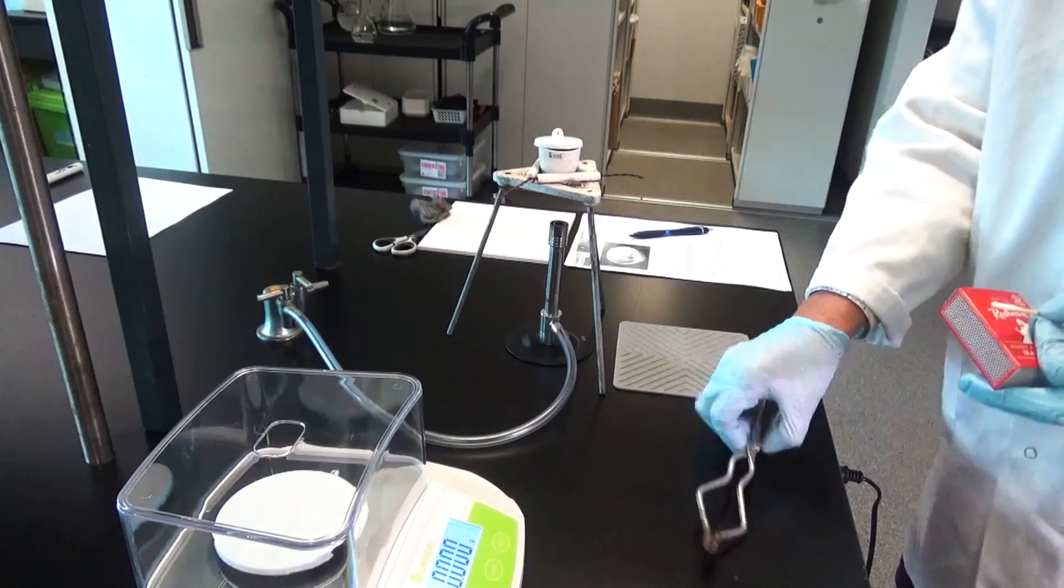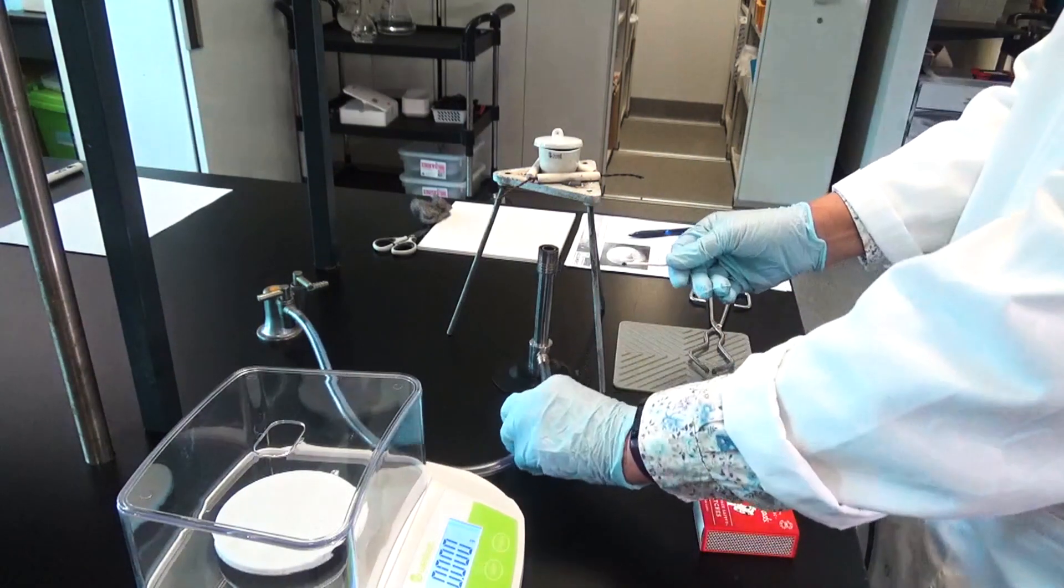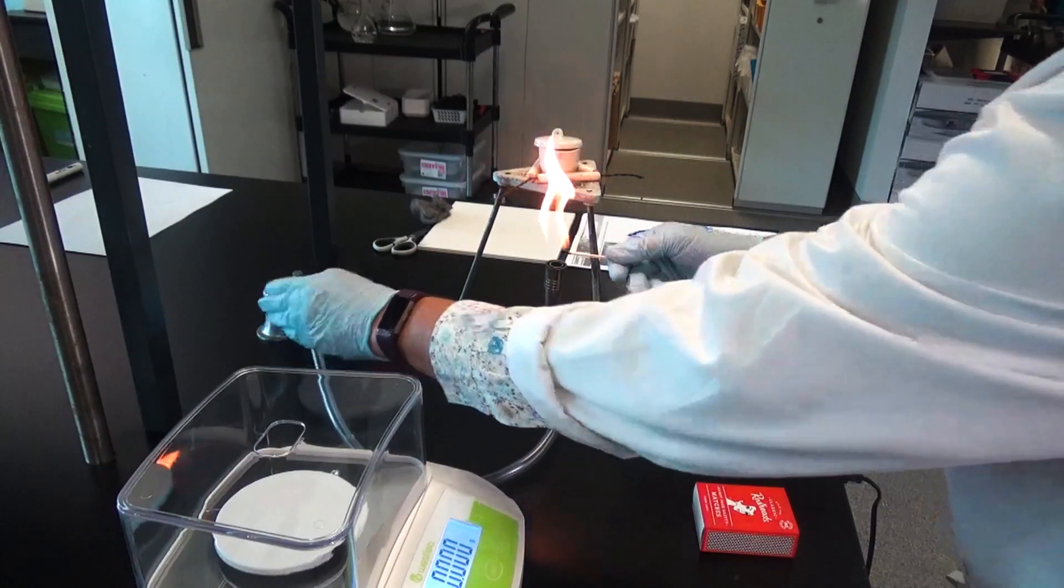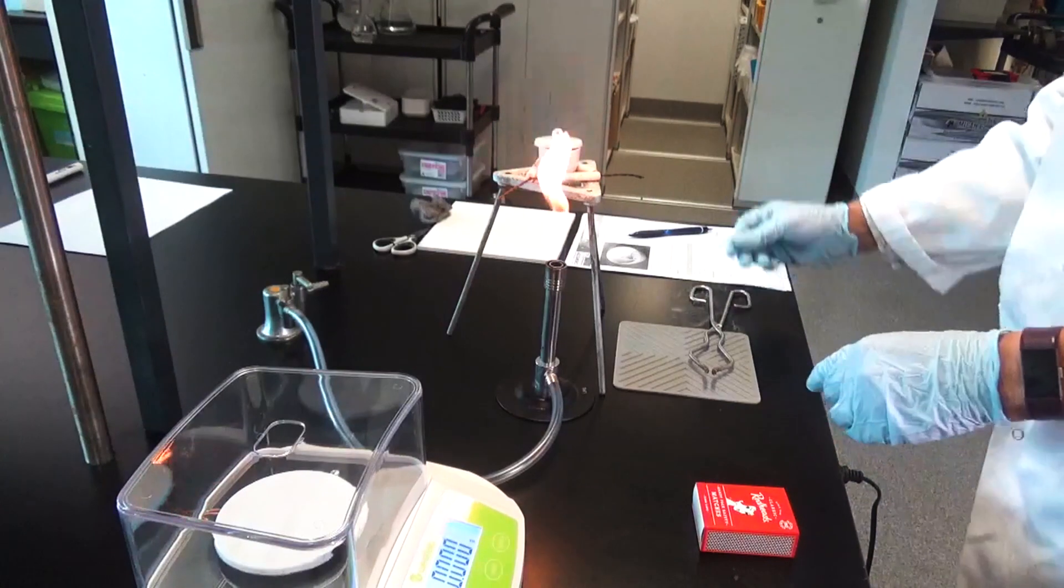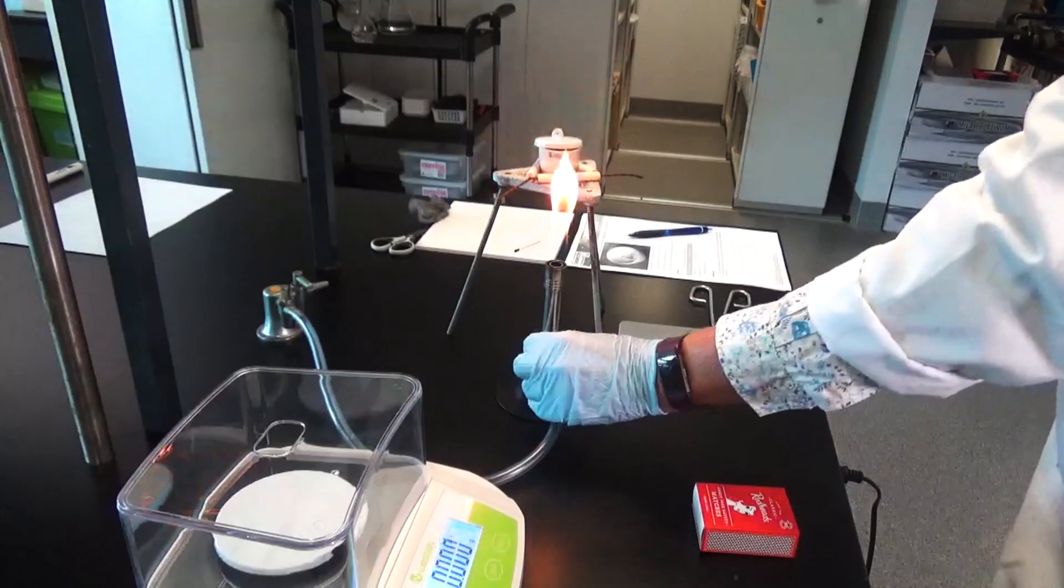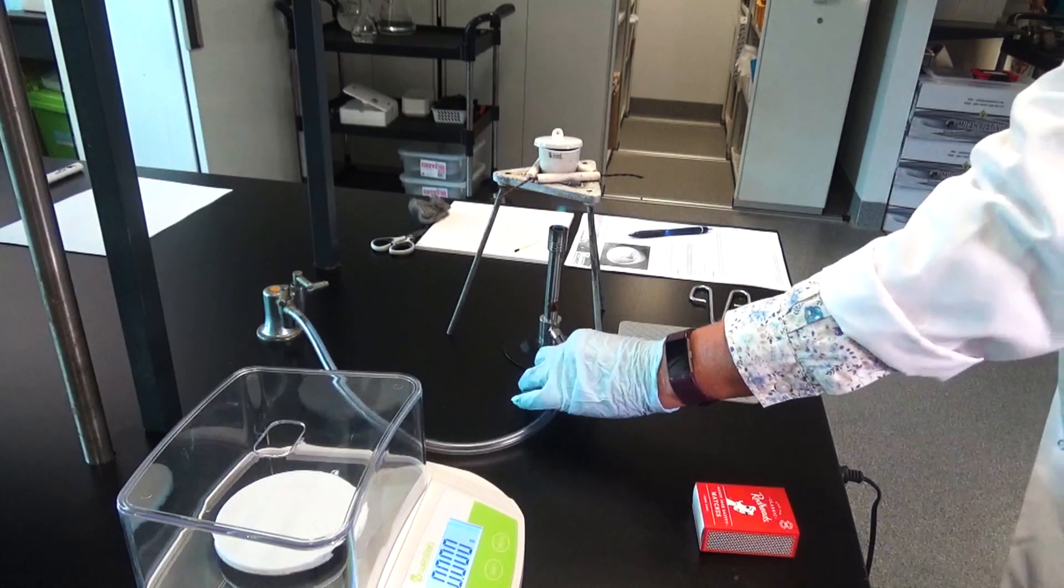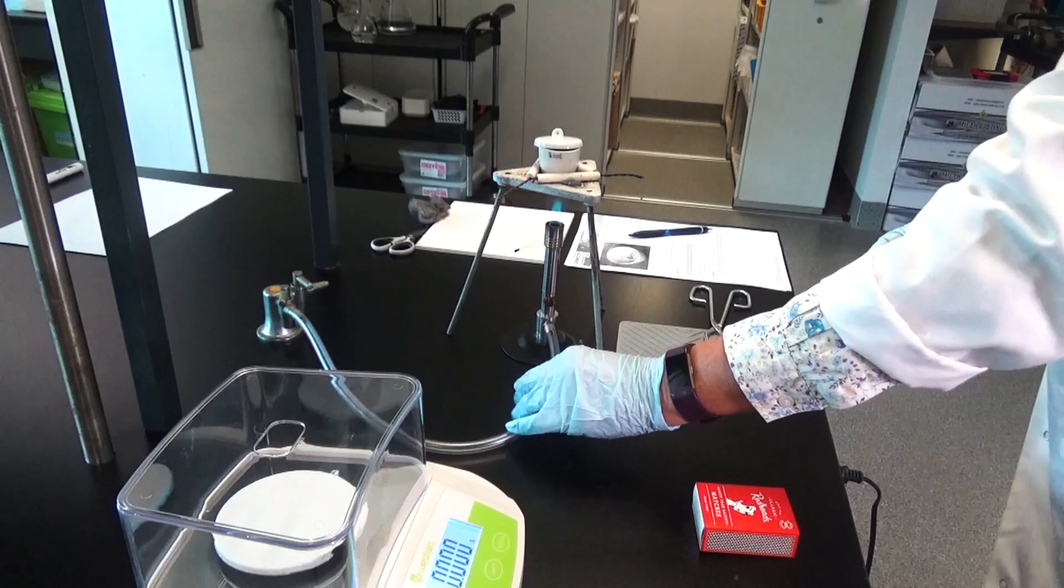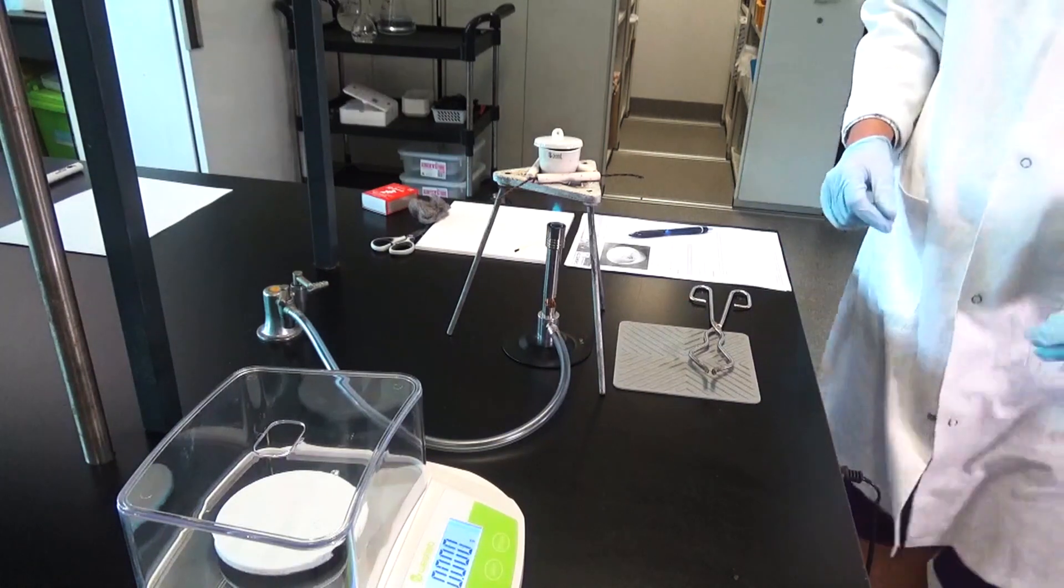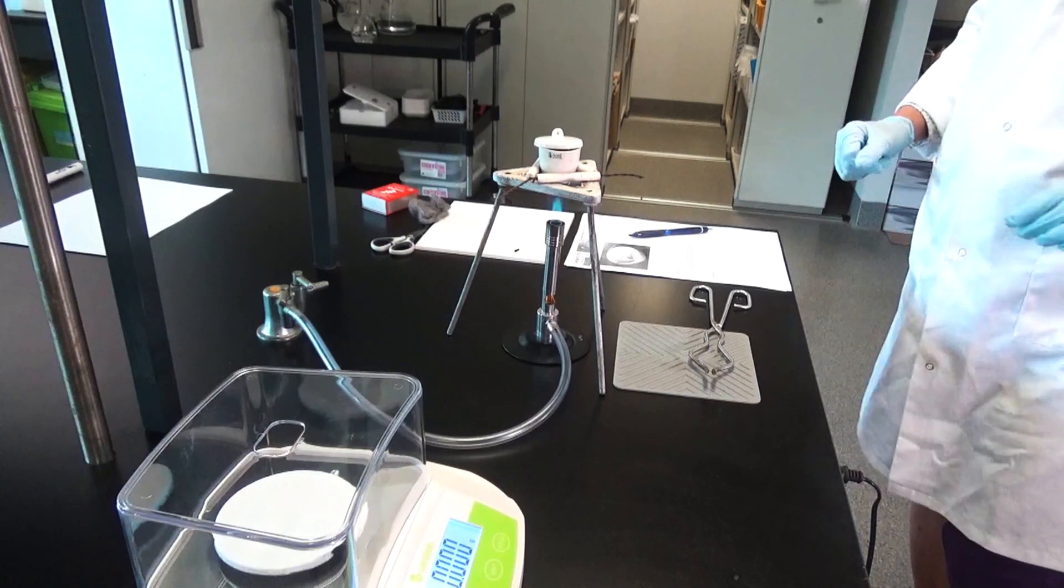And then open this air hole and we heat this strongly. So we let that sit there and heat strongly and we'll leave it until all of that magnesium has reacted with oxygen.